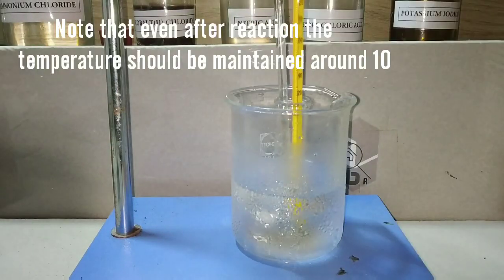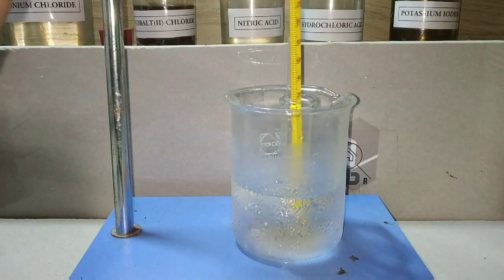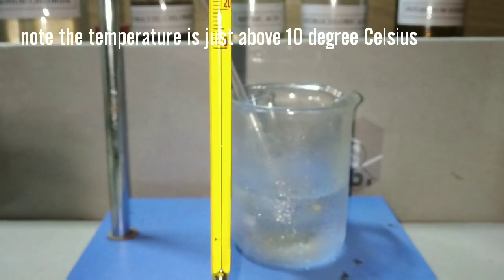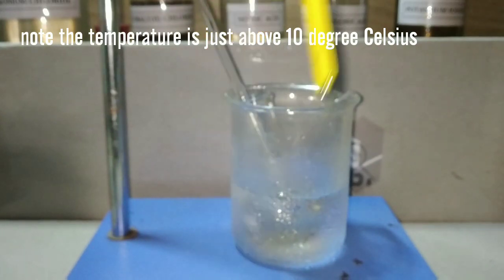Take the temperature periodically and check for any increase in temperature. After the reaction has completed, you can see that the temperature is still around 10 degrees Celsius.